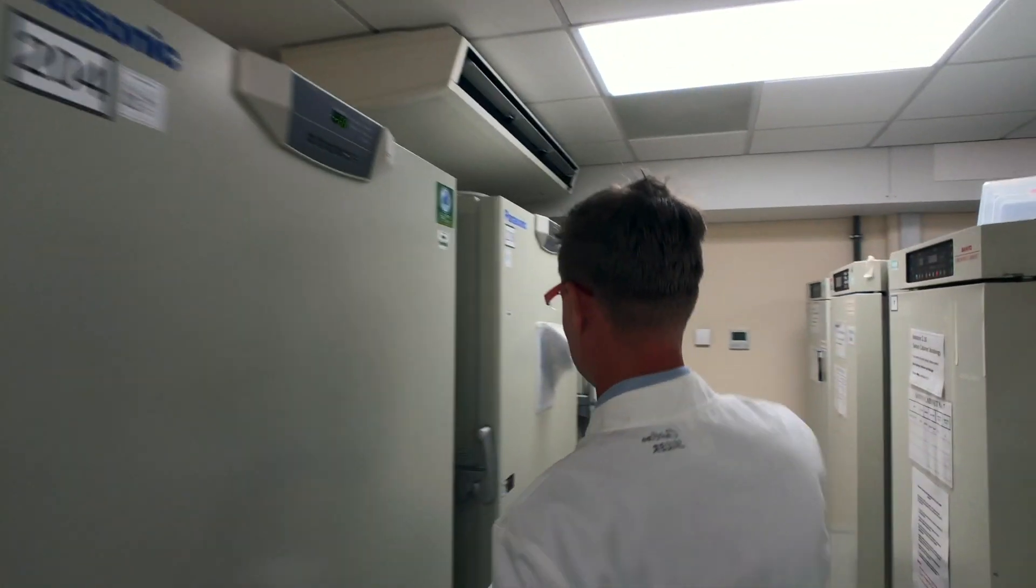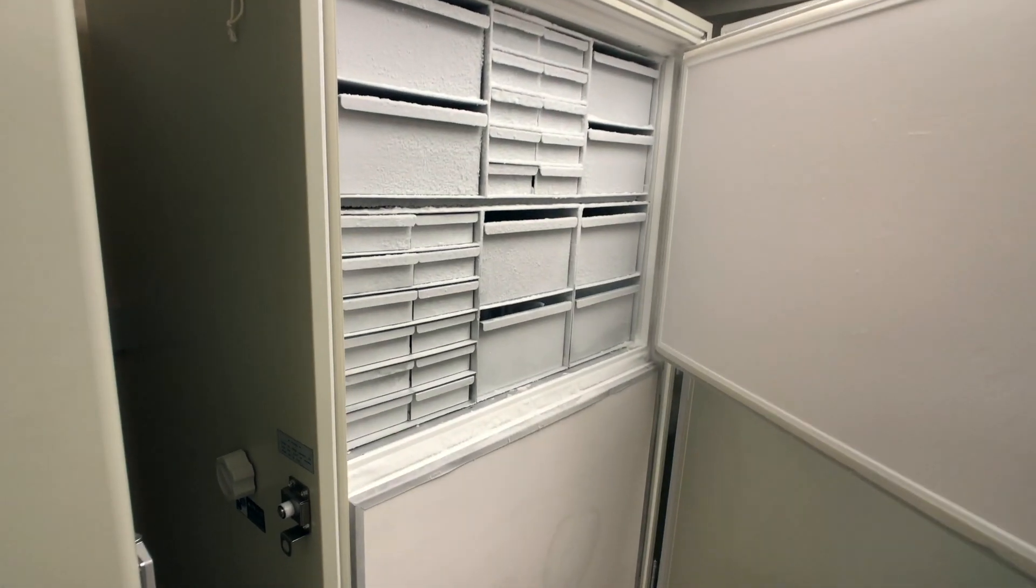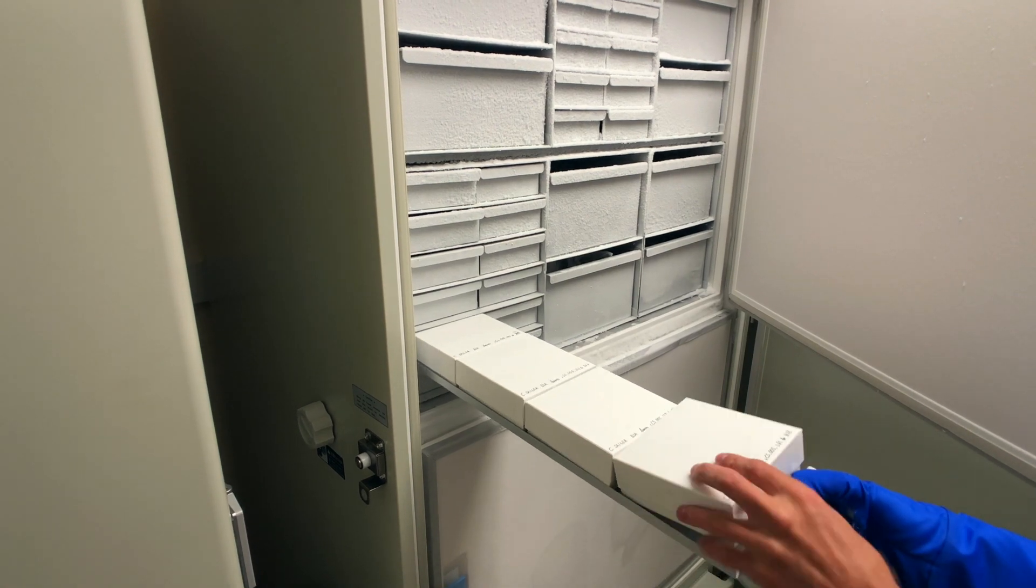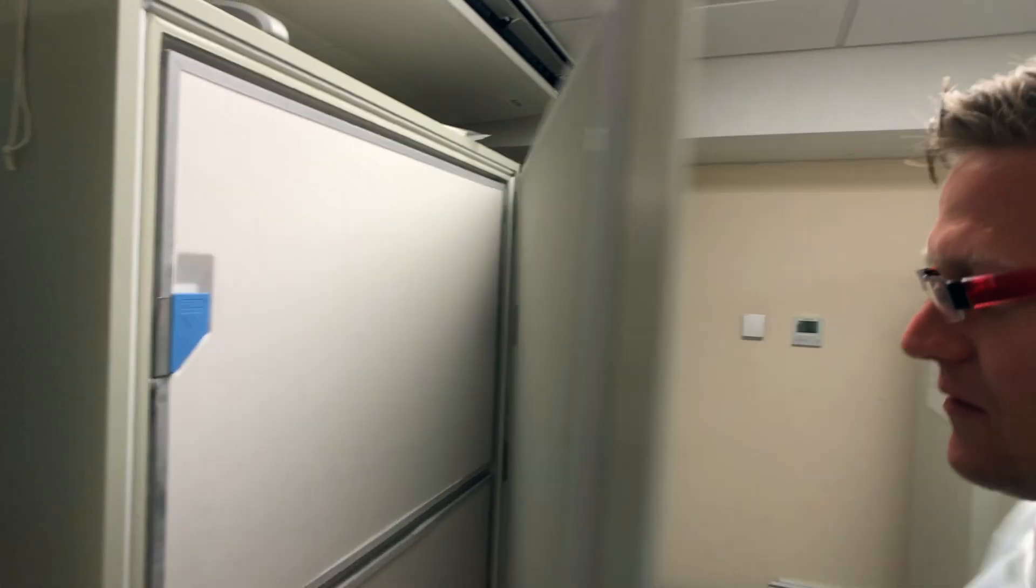Now we're going to store them in the minus 80 freezer. They'll stay in here until we go to the lab and extract the DNA.